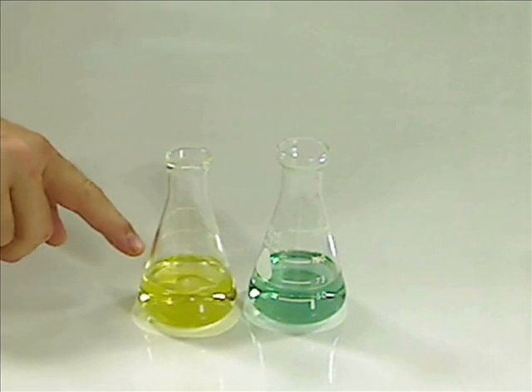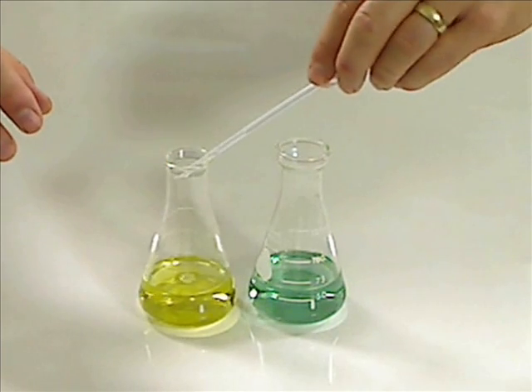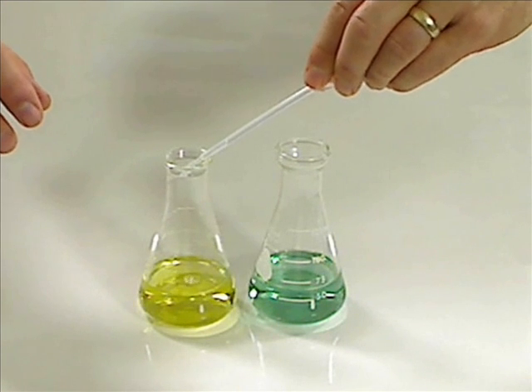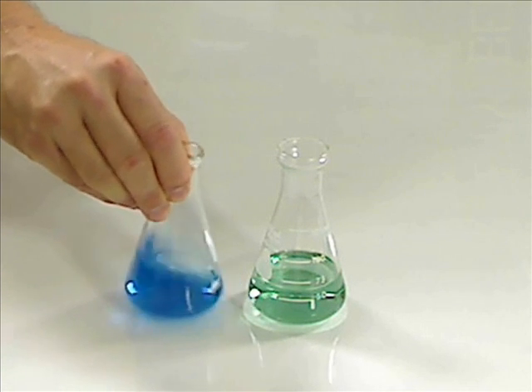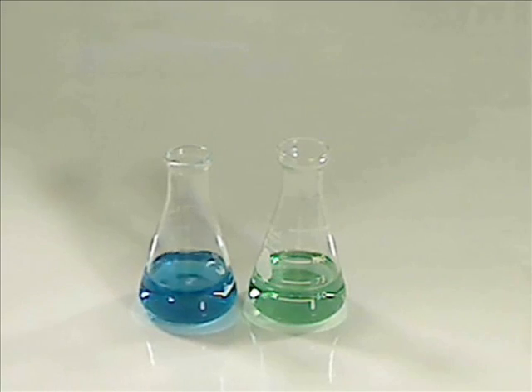We're no longer yellow. We're more of a very slight green. So now all I need is a partial drop of the base. In this case, actually, I overshot the indicator.